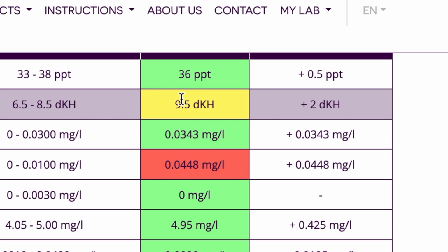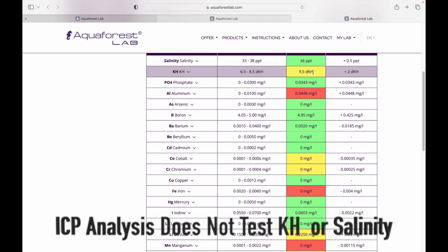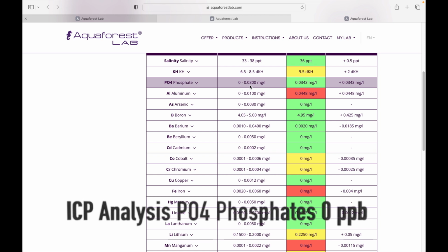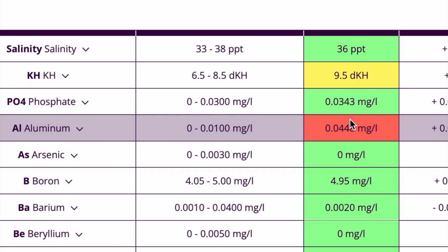KH is a little bit high. It's showing 9.5. I believe I'm testing at about 9.1 or 9.2. I like to keep it about 9. Phosphates are showing 0.03, which is okay, actually. It's showing my aluminum as being high here. Yeah, it's showing that this is elevated and needs addressing.